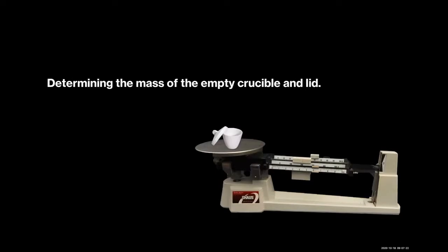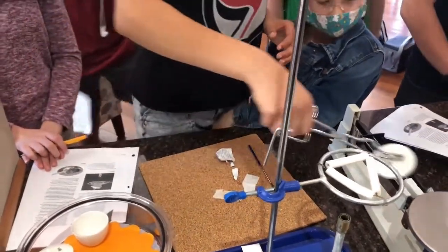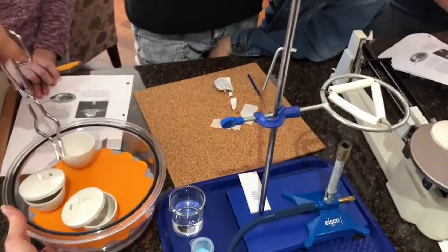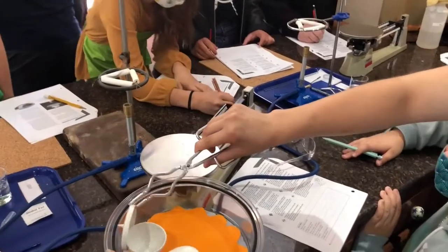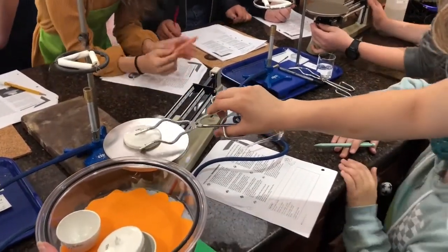Determining the mass of the empty crucible and lid. It won't burn the counter because the counter's granite. Not yours, not yours. Okay. Coming around. Okay, well, work on it till I get there. I'm almost there. Go. Good deal.